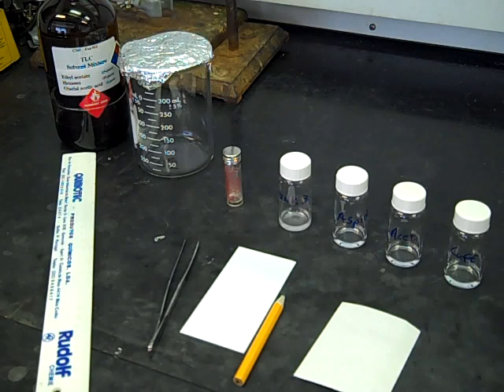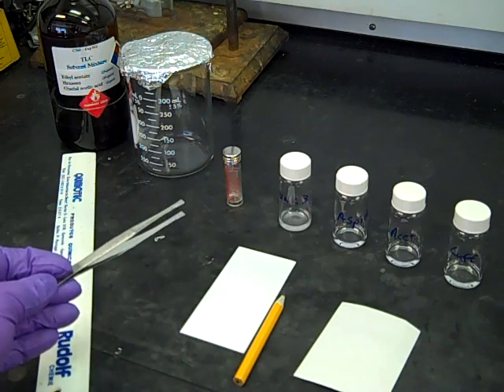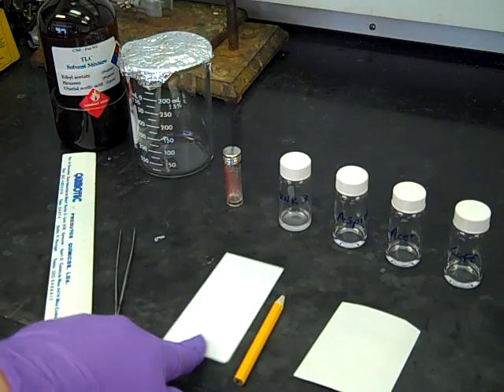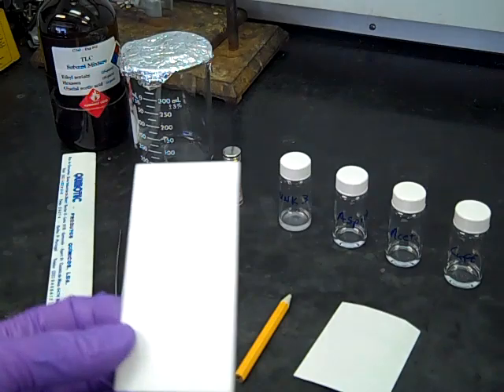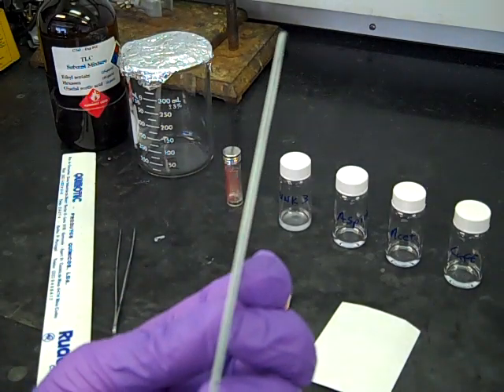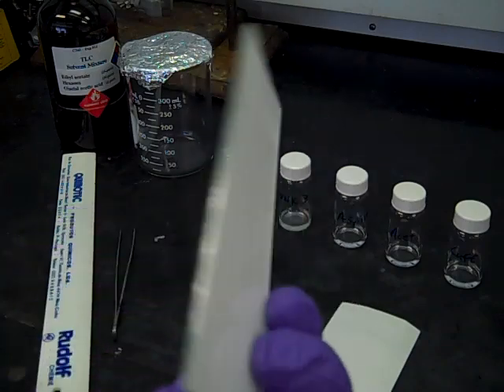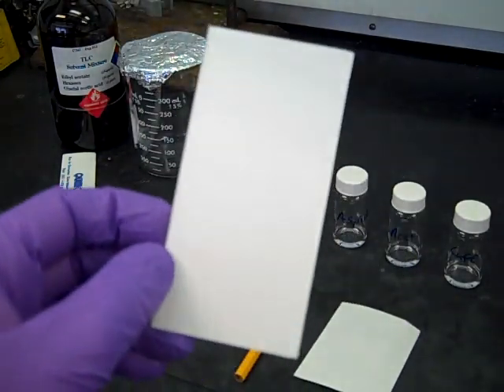Here's the basic setup we're going to need for this lab. We've got a ruler, a pair of tweezers that should be in your drawer, and one of our TLC plates. This is a glass plate with the silica gel adsorbed on it—it's really thin, hence the name thin layer chromatography. You've got one side with the silica and the other side is a glass back. You can see the reflections there, so you're going to be doing all of your work on this silica gel side.